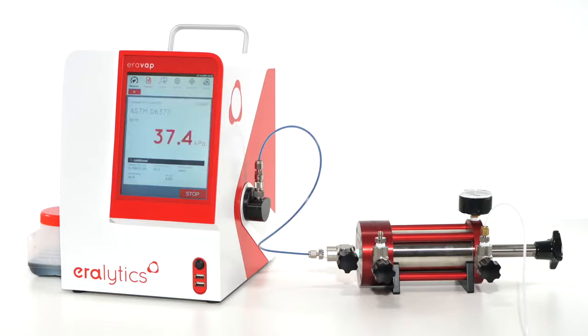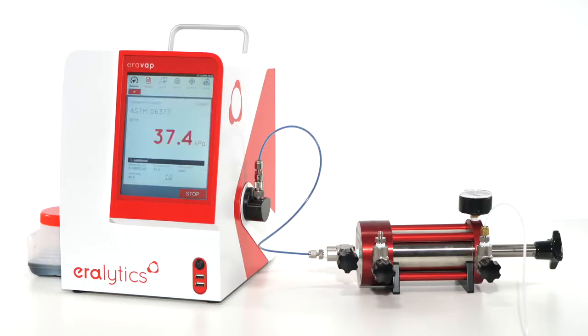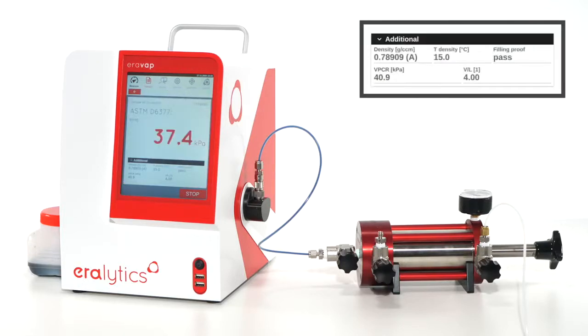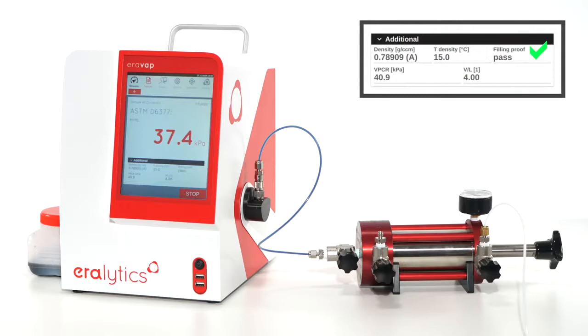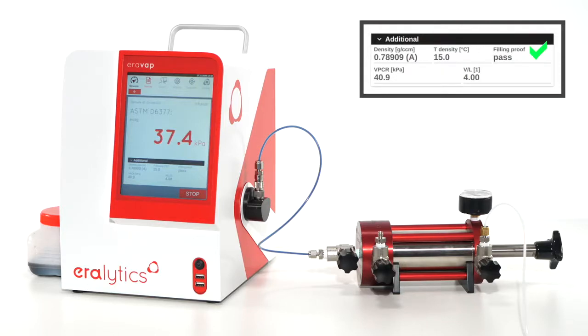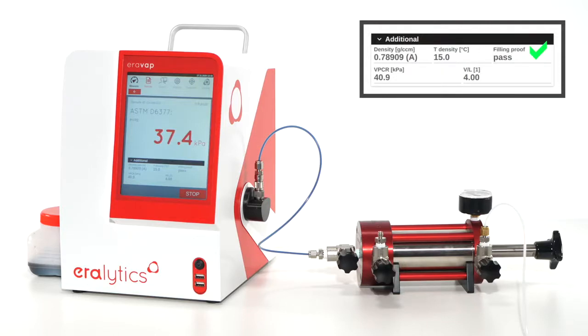The detailed result screen contains the vapor pressure result and the determined density, including the verification filling proof.